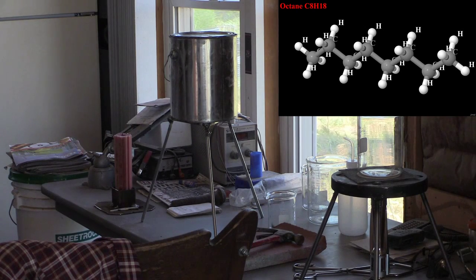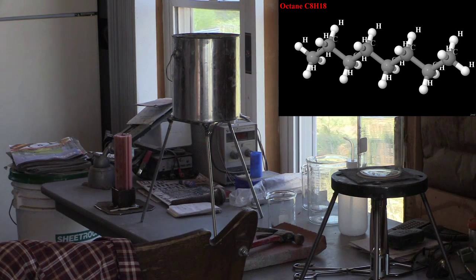And now, let's see what happens. I'd say that was the perfect amount.